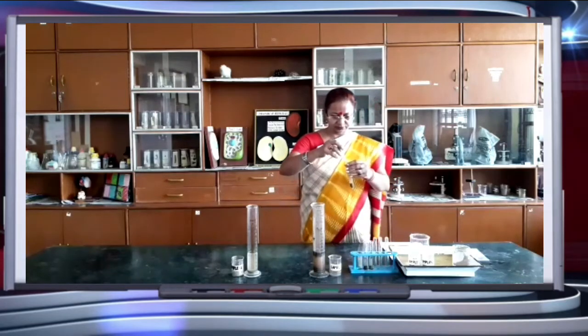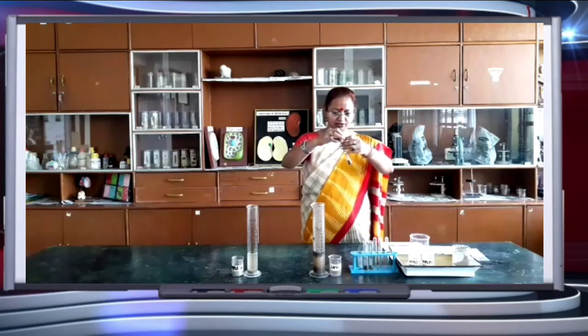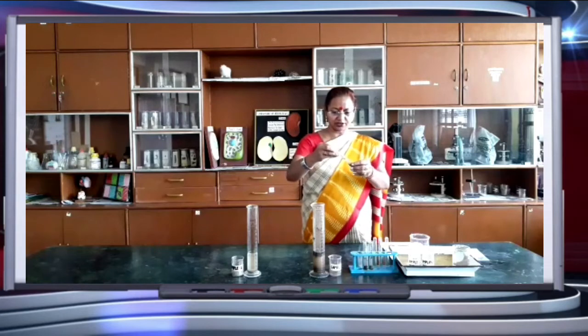Sample 1. Let's see, is there any change in color of the pH paper?